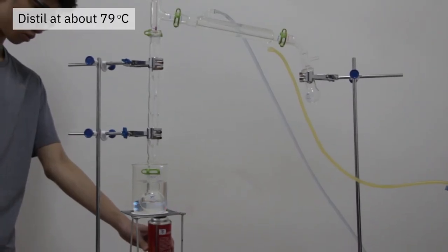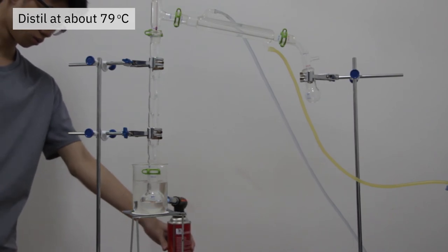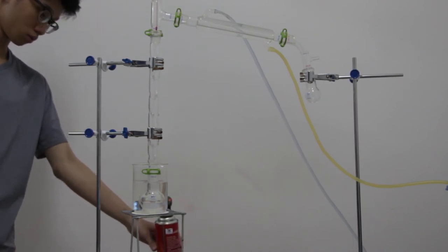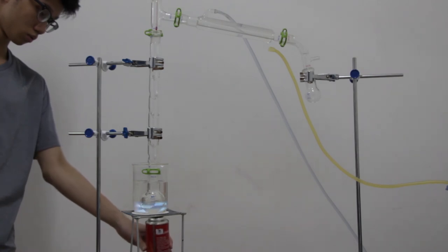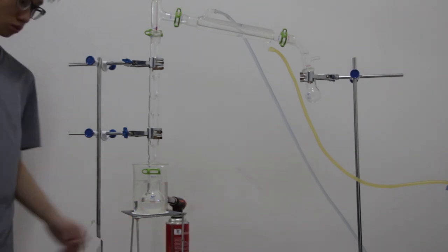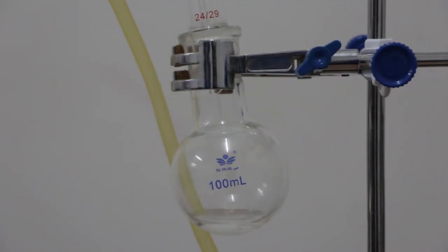The content of the flask is then distilled at a temperature of 79 degrees Celsius. By this point, our supply of Bunsen gas has run out and we opted to use the propane torch instead. The ethyl acetate is collected.